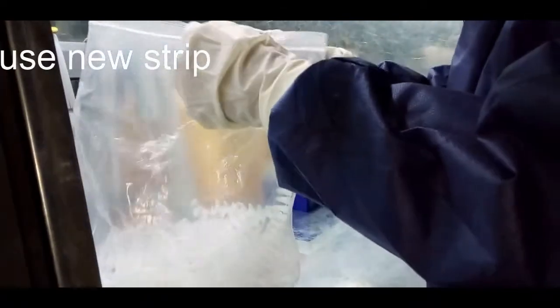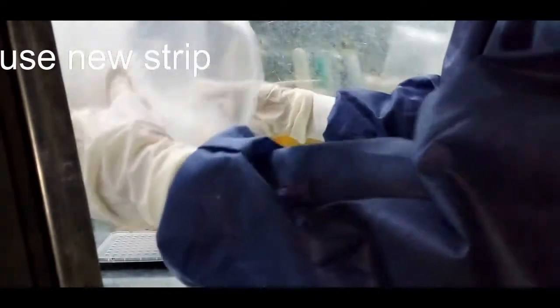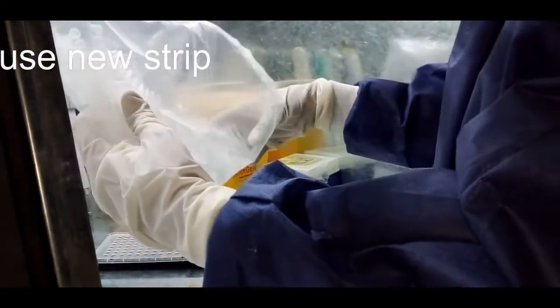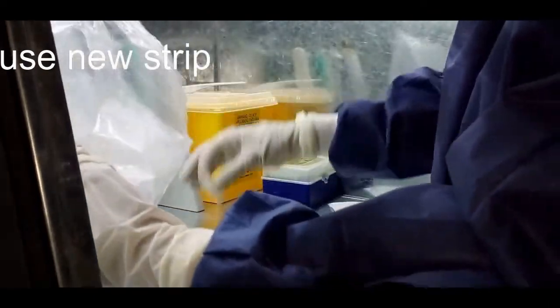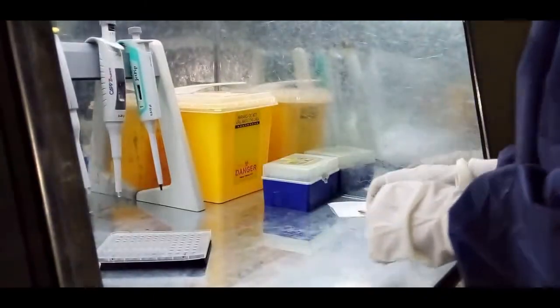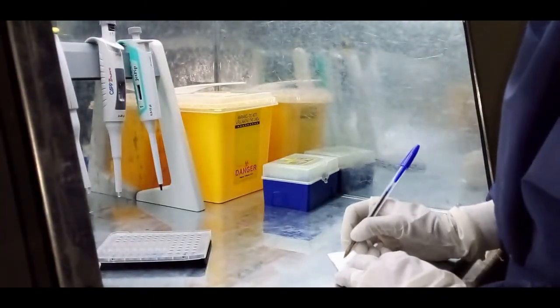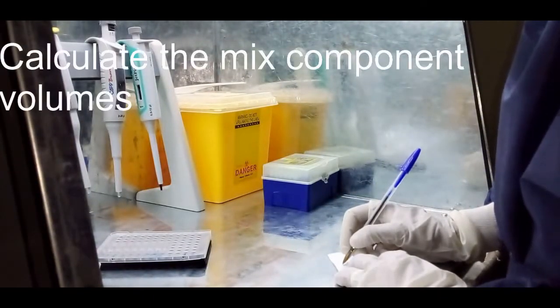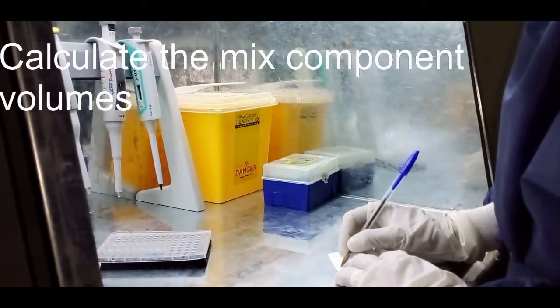Use new strip of tube. Calculate the master mix volume required for number of sample, plus 2 control, plus error.